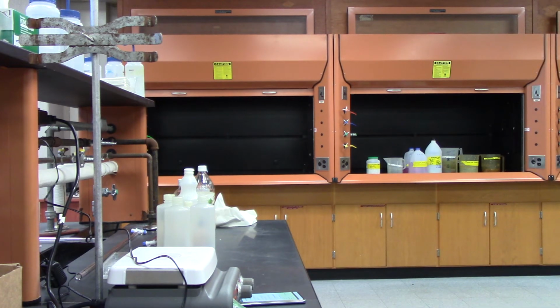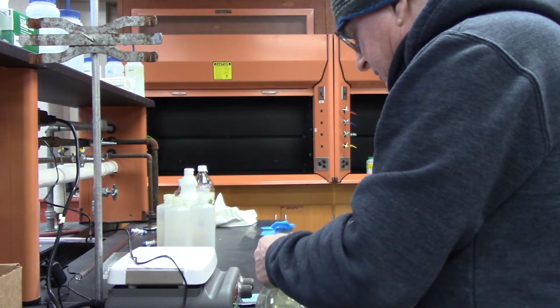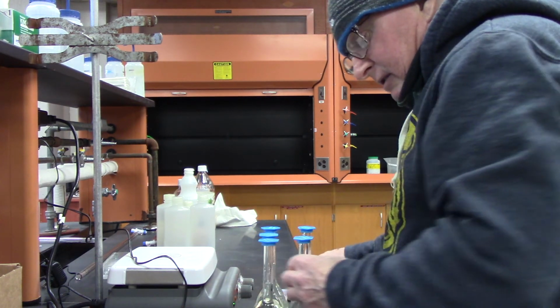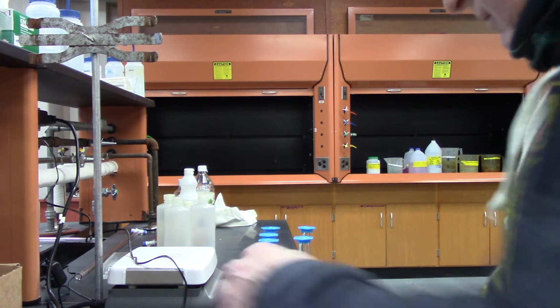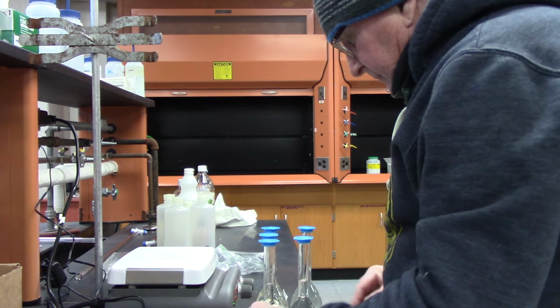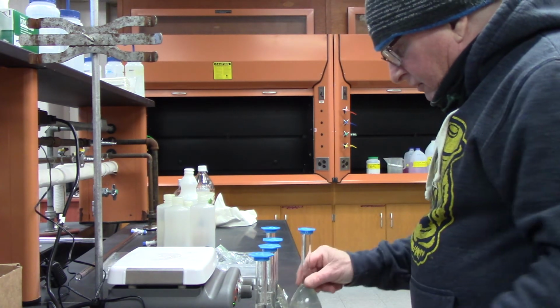And I bring my samples over. So, 1, 2, 3, 4, 5.